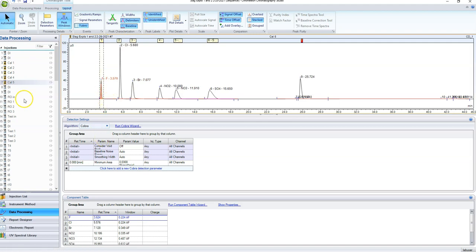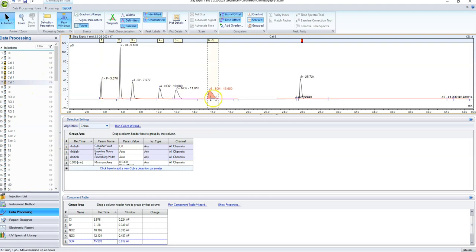All right, so that's pretty good. So another tip, you can see here that this peak actually looks a little strange. This is what's called tailing. So the peak is kind of shifting to the left. This is because this is my highest calibration curve. It means that the concentration is getting right about to its upper limit, and it's starting to overload the column. So when your peaks get too big, you might get some huge peak that encompasses all of these, which is why we stay under 100 parts per million. It looks like I forgot to do phosphate.